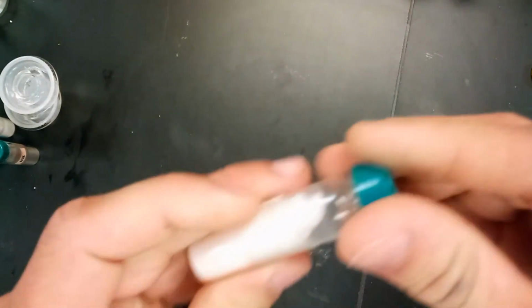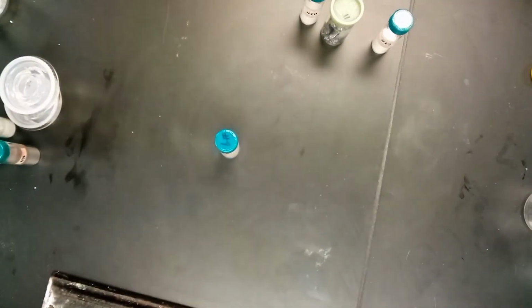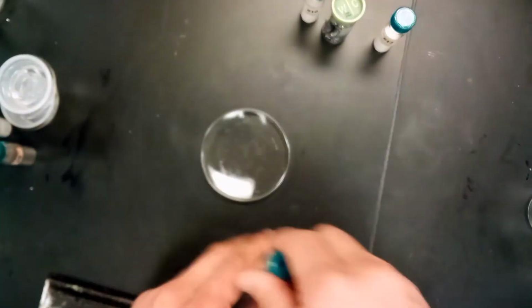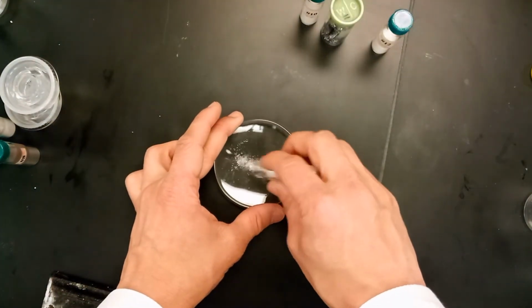Next one here, we've got number 9. So another sort of crystal white powder. Got a few of those actually. Number 10 is going to look like that too, and so is number 12. So we have to have some way of distinguishing what these are. Since we have to distinguish between them, one of the best indications is going to be pH level.